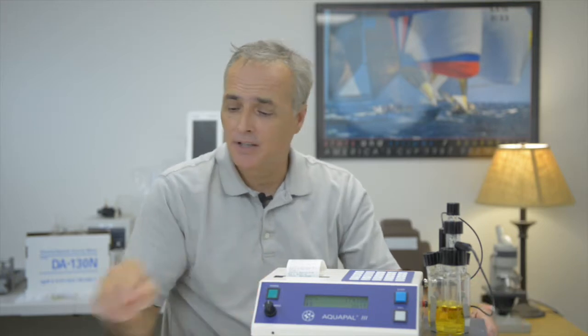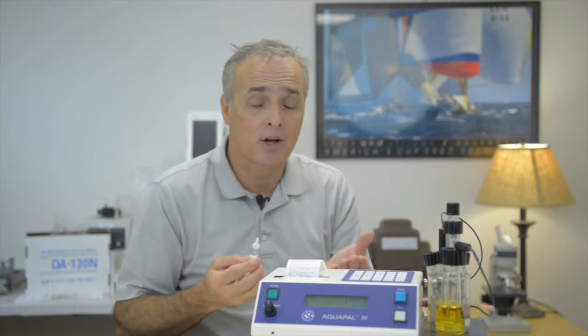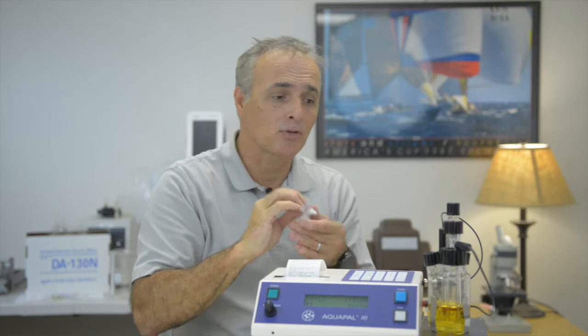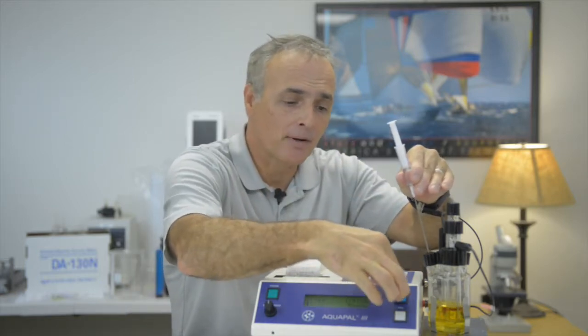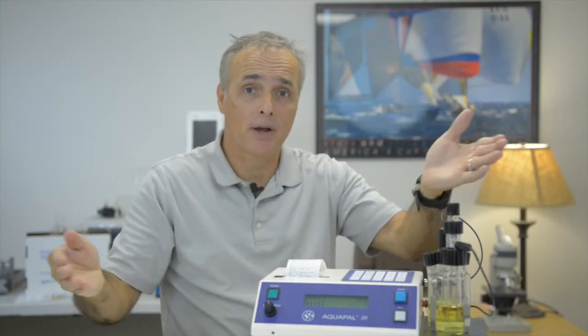Now, here's the key. We're ready for another test. Do I need to enter any other additional information, ppm and V over SG? No, I don't. All I need to do is press the start button and inject my sample. I have a 6-second delay to inject the sample. So what I typically would do is get my needle ready, then press the start button, and then inject my sample, and the second test is now underway.